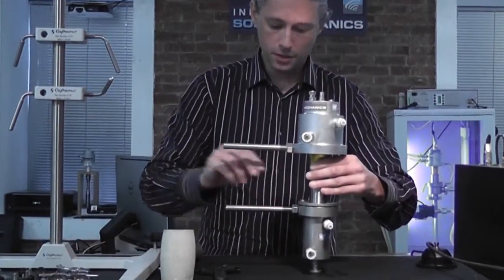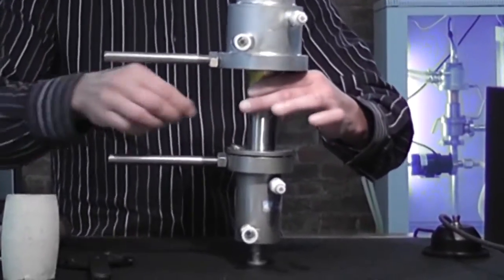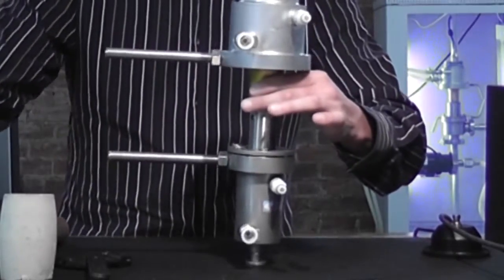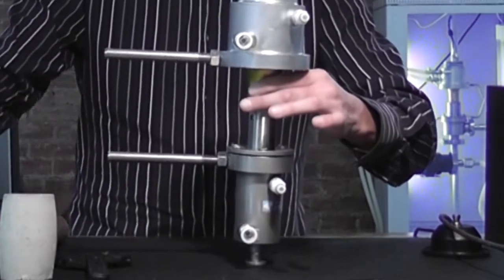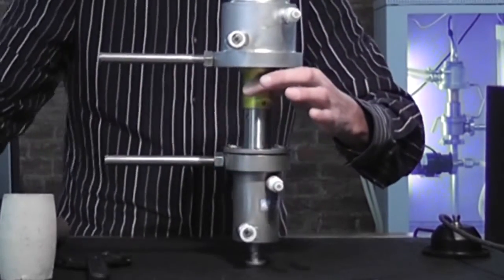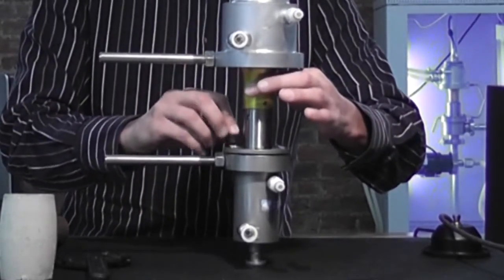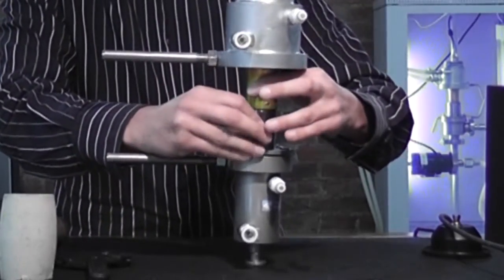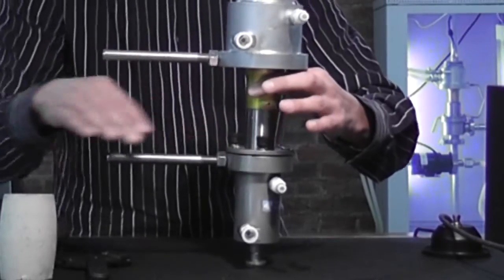You can now place the locking washers over the holes in the lid. Put in the thumb bolts, without tightening for now.